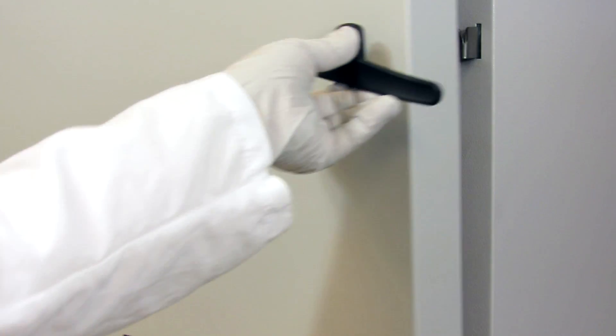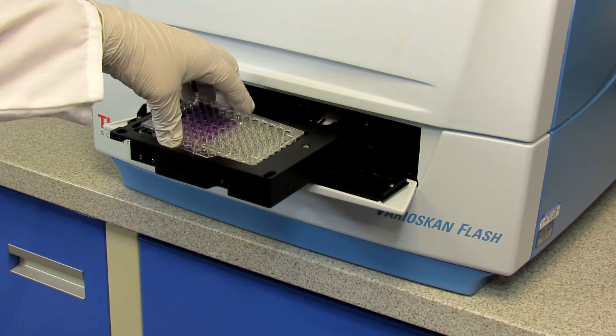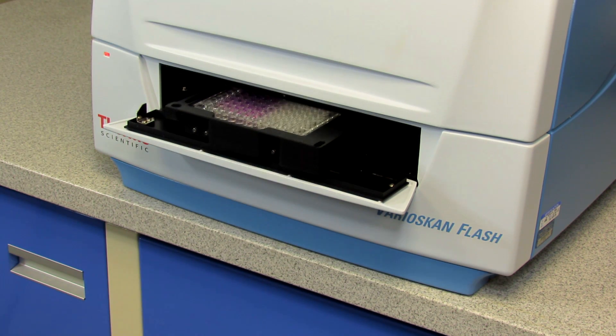After cooling the plate at room temperature for 5 minutes, measure the absorbance at or near 562 nanometers with a plate reader.